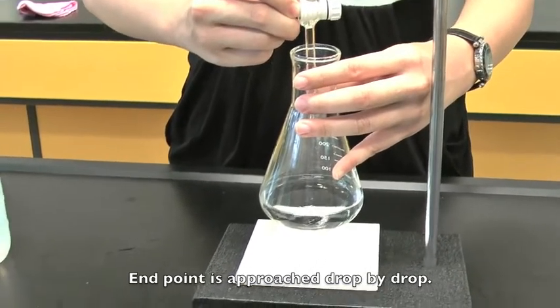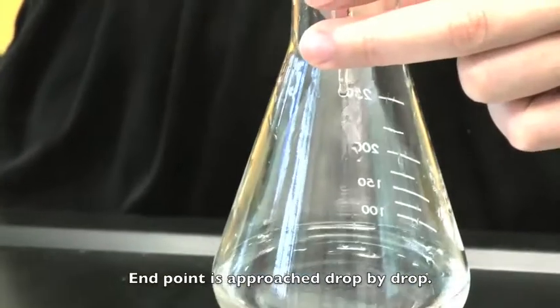Then, continue with the titration, drop by drop.